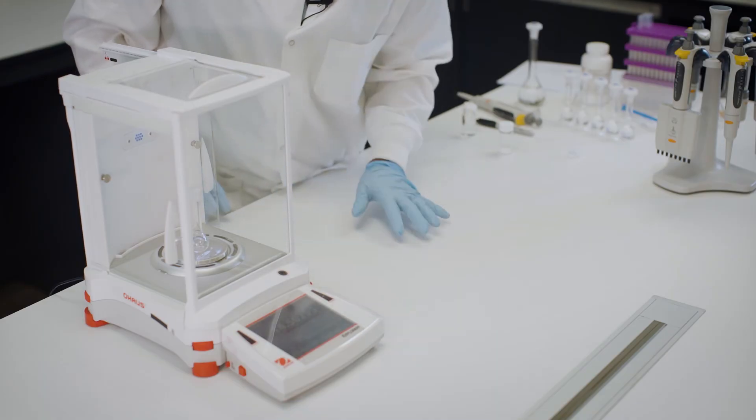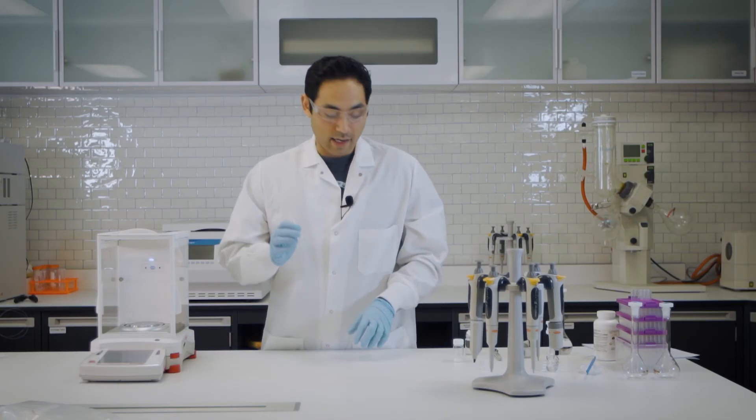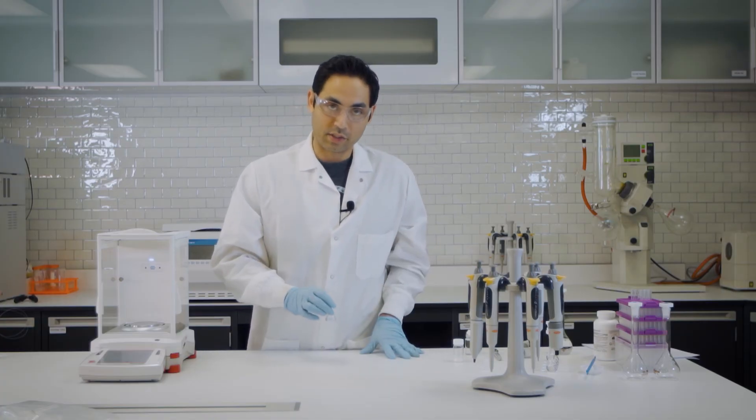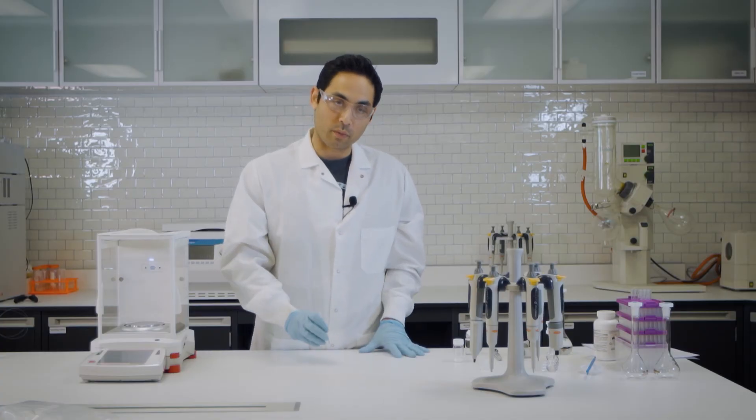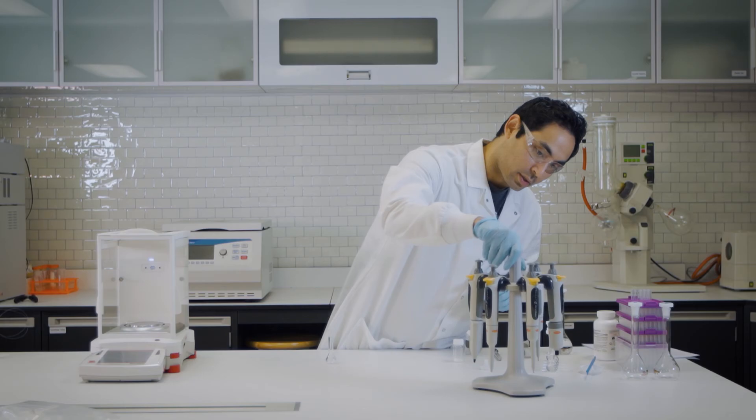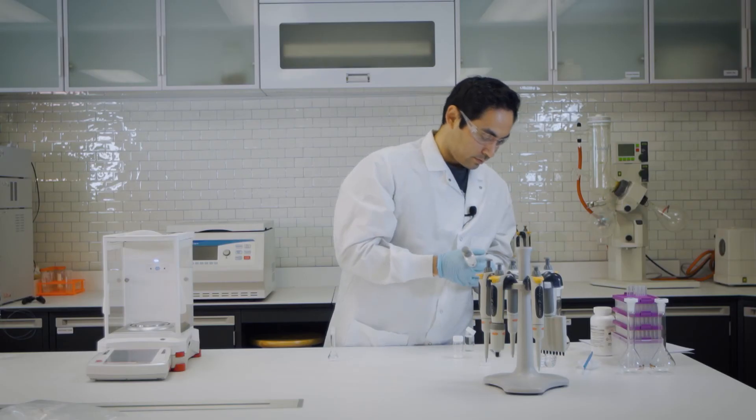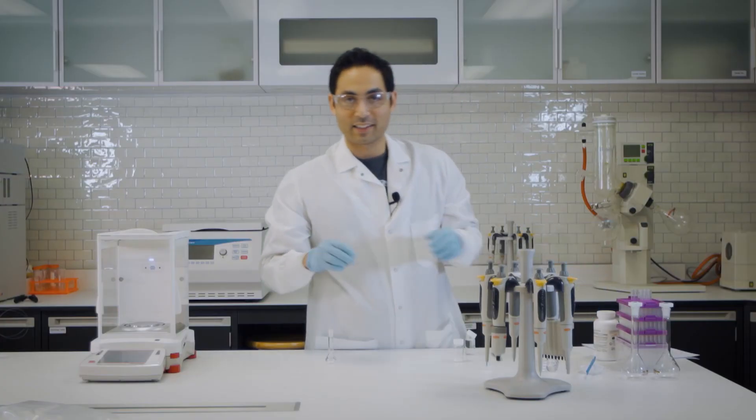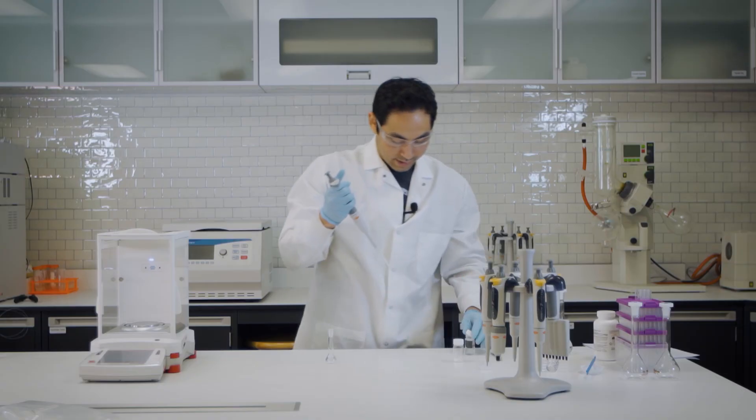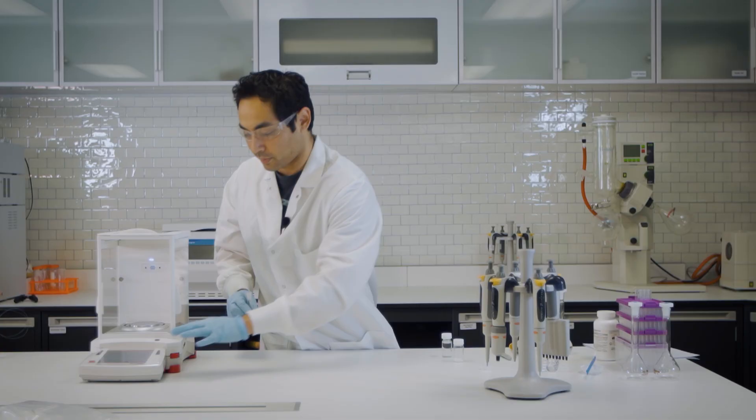Let's put that in there. Okay, so now that that's tared, we're going to add our stock solution in there. Again, it's one ml into 10 ml. So let's weigh the one ml first. Let's grab our one ml pipette. And let's take our one ml of stock solution. Let's get it in the volumetric. And let's weigh this.